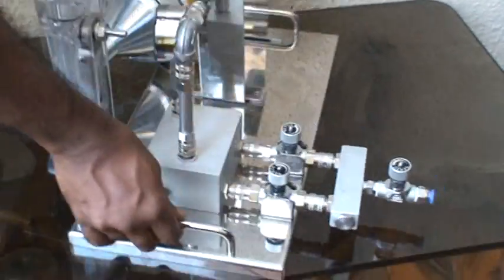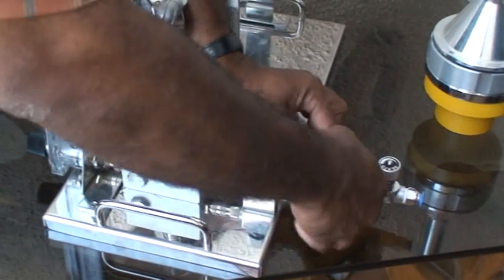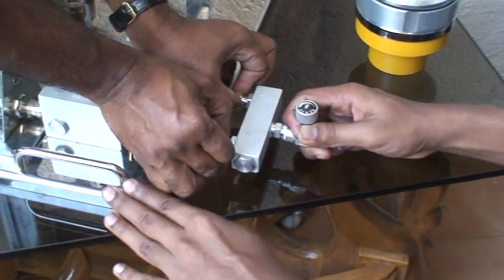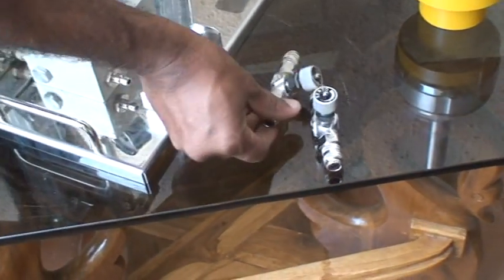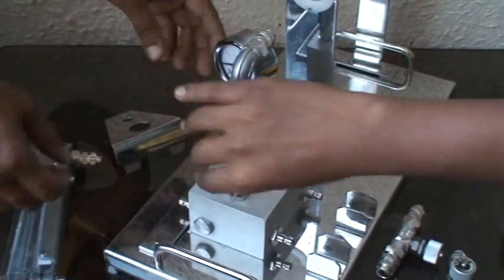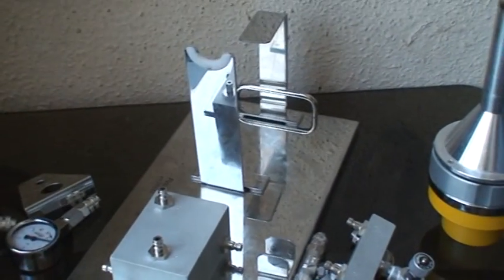The parts are very easy to dismantle — just pull and they come out. Other parts are also very easy to dismantle and assemble, and can be stored away. It is a very simple system. If you have any queries, you can contact us. Thank you.